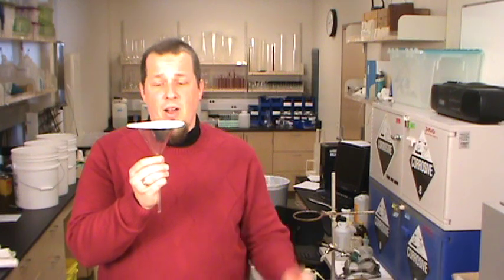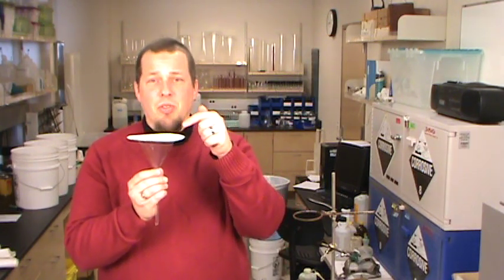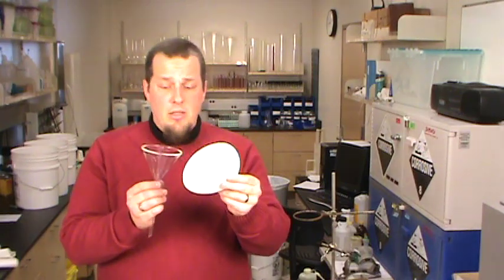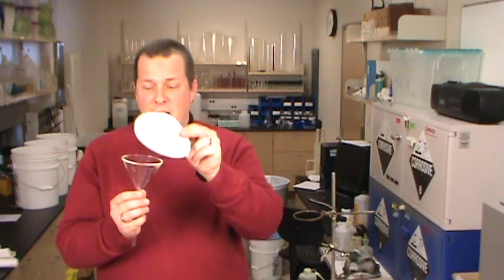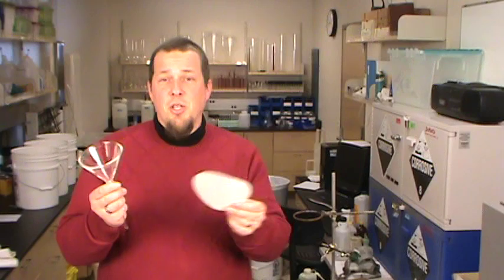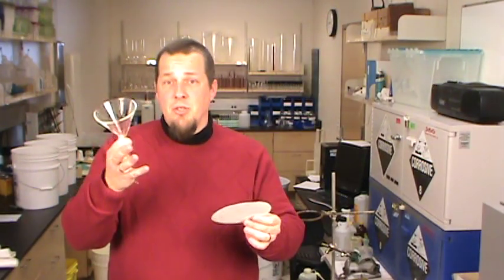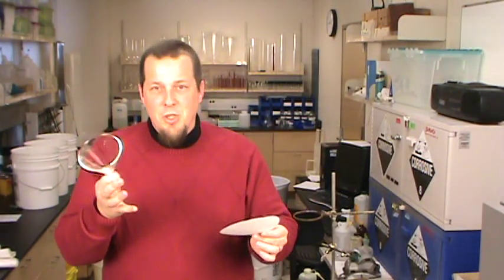I have seen people try doing it this way but it doesn't work very well. So how can we make this somehow fit into that funnel? There's a little bit of geometry involved if you're really interested, but we'll dispense with that for now. You basically have two options when you're trying to fold a filter paper to fit in that funnel: you can either do a simple quarter folded cone, or if you're feeling a little fancier, if your reaction requires it, you can use a fluted filter paper.